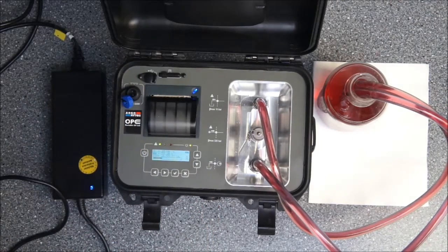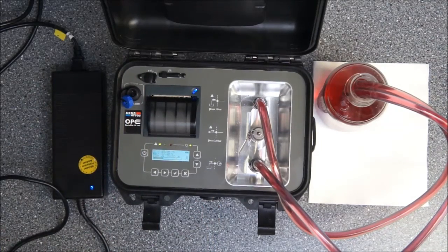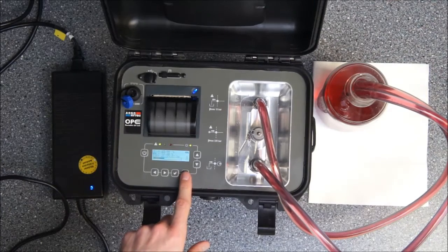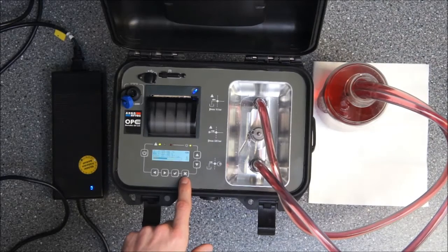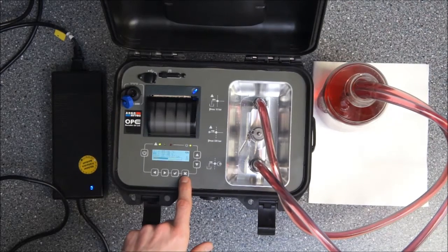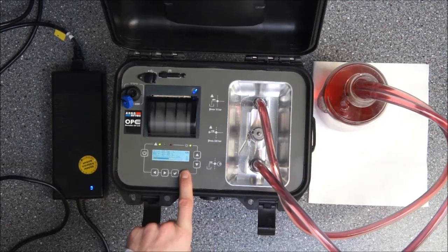As we have seen now the pressure with the pump, the internal one, we want to change to the high pressure mode. To do so I will first of all stop the measurement of the pump by pushing one time the back or abort button.